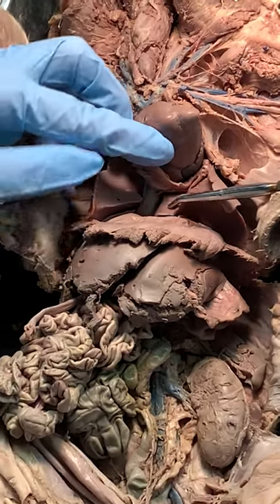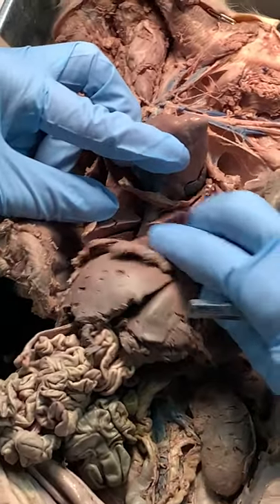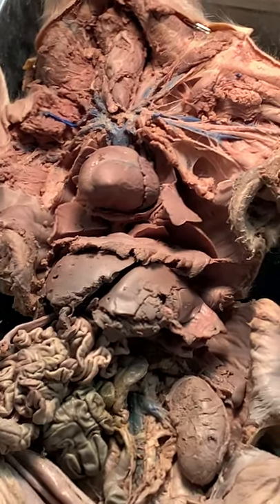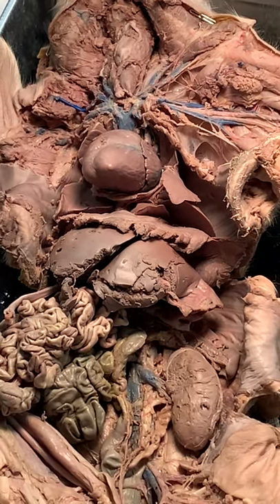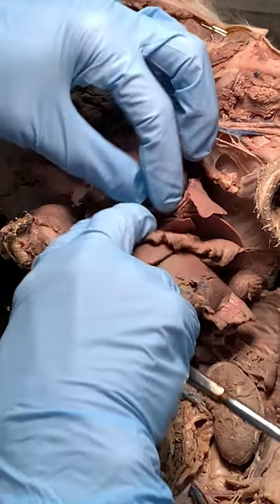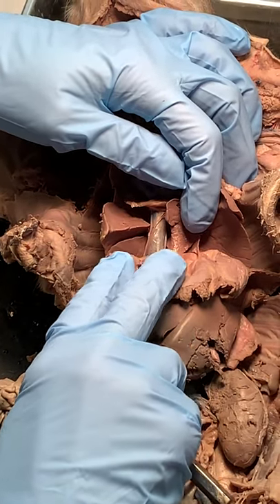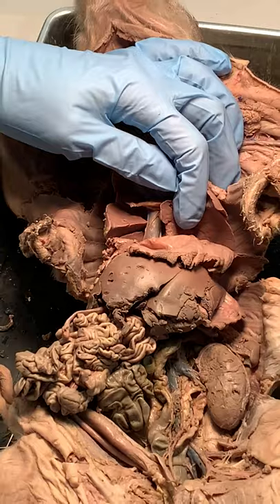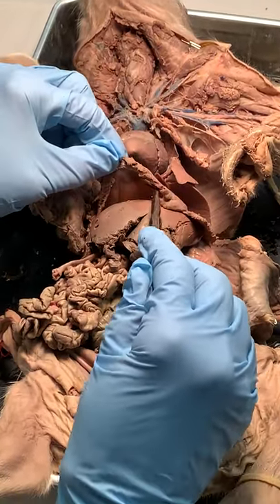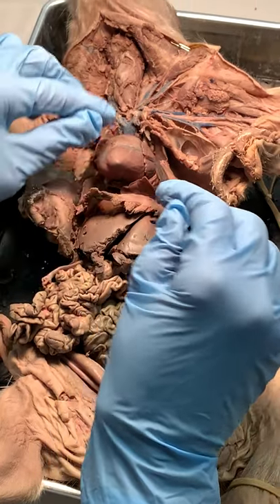Under the heart, or posteriorly, I've got a posterior vena cava. That's the blue thing going all the way down. I'm above the diaphragm here, so I want to focus — the posterior vena cava is still above the diaphragm.